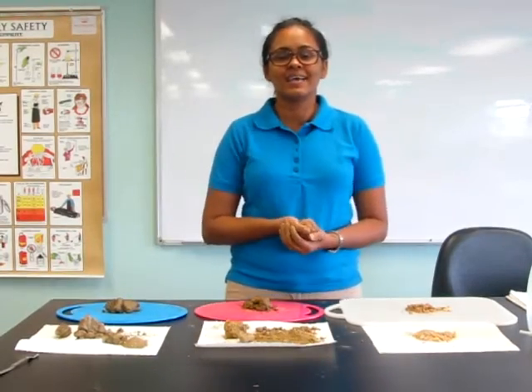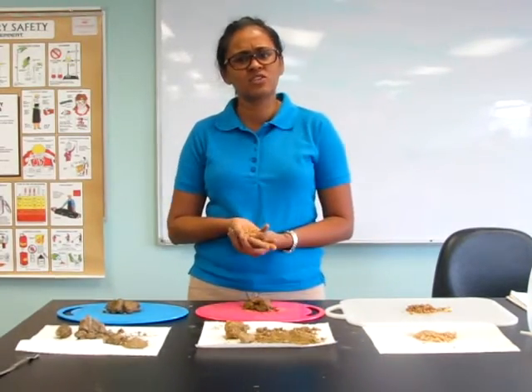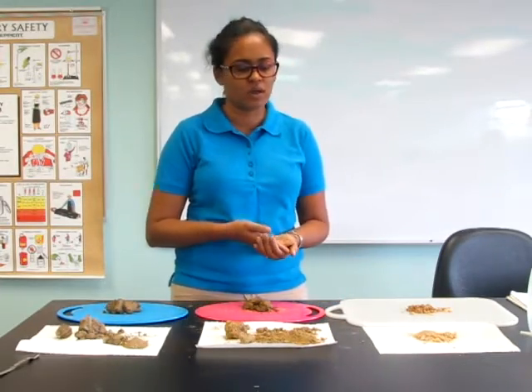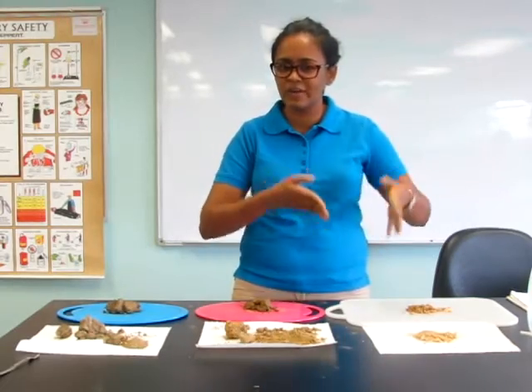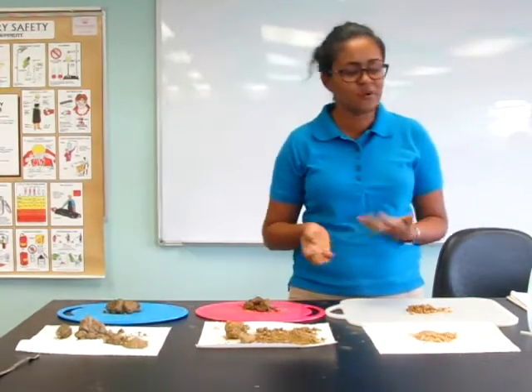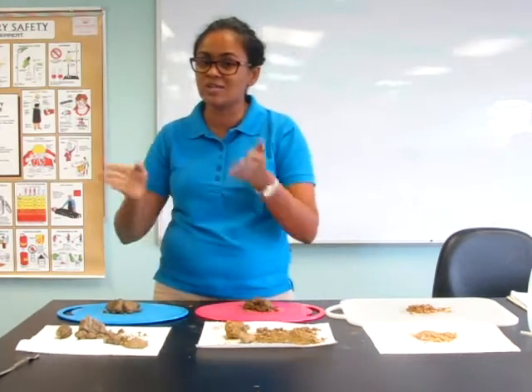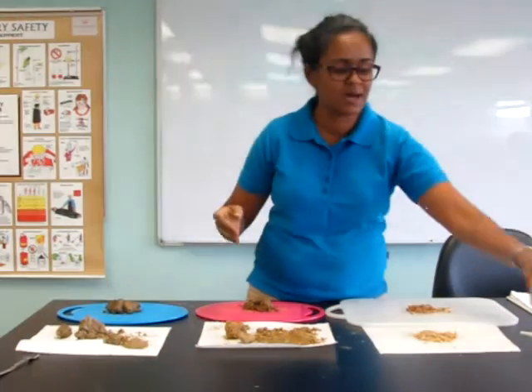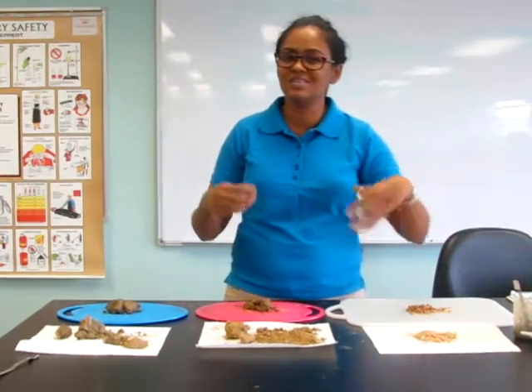Good day, we are here today to do our soil texture analysis. We have three main soil types: sandy soil, clay soil, and loamy soil. Here we have three soil samples and we are about to determine which soil sample falls in which category. We have soil sample A, soil sample B, and soil sample C. We also have our distilled water, our beaker, and our spatula.